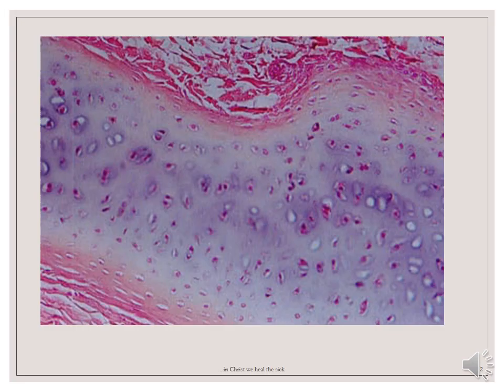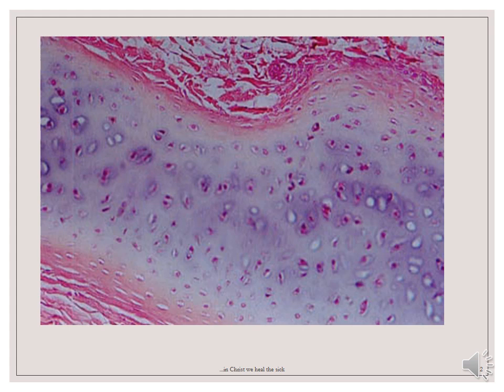We will start by going through the slide of hyaline cartilage. A cartilage is formed from a highly specialized type of connective tissue, therefore a cartilage is made up of an extracellular matrix as well as the cells that synthesize these matrices. This matrix is composed of a ground substance and fibers. In the case of a cartilage, the fiber we will talk about is type 2 collagen.